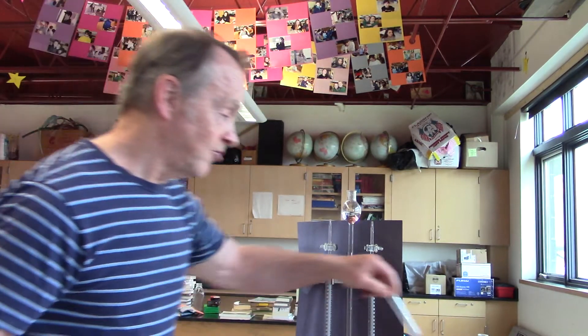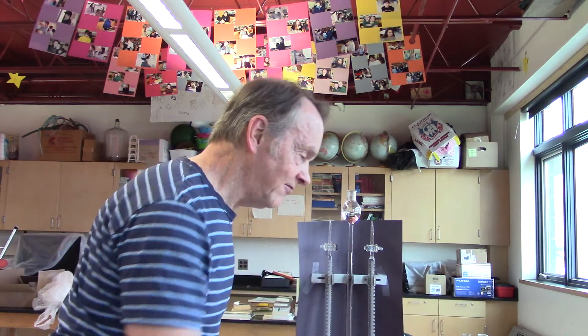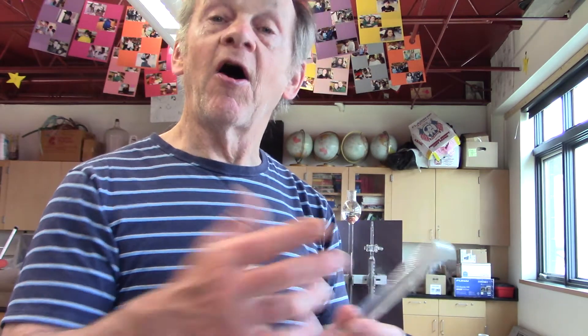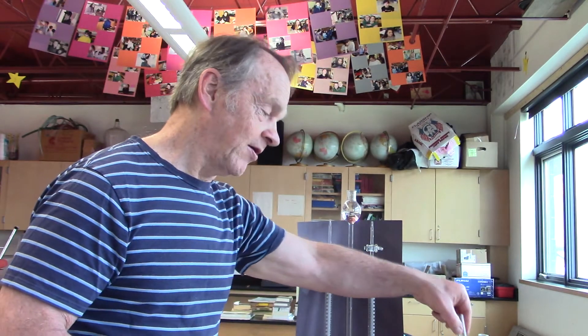Okay, so oxygen, hydrogen. Oxygen reacts with stuff and it burns. Hydrogen reacts with oxygen in the air and makes water. And so we ended up with some water in there and I forgot to show it to you.